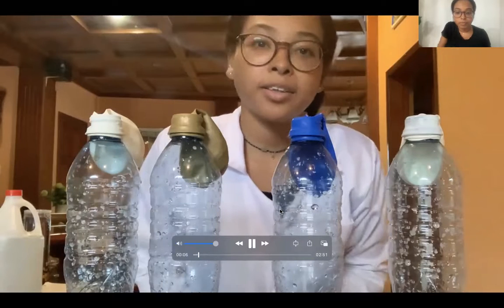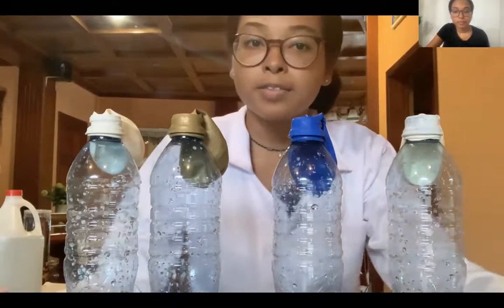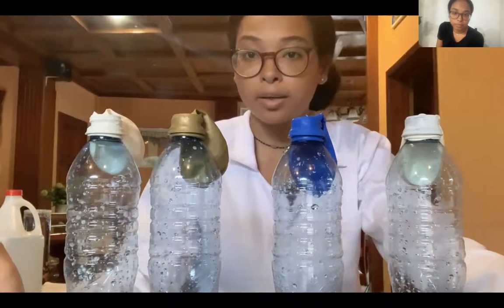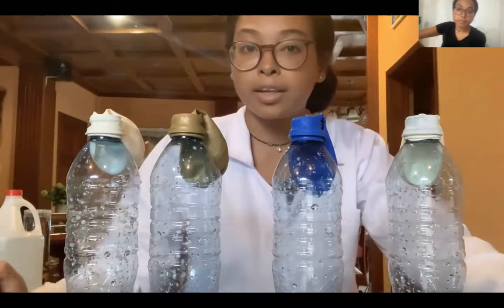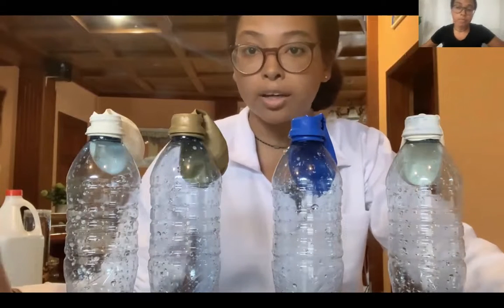My name is Anna. Today I'm conducting an experiment on limiting reactant. The purpose of this experiment is to find the limiting reagent when sodium bicarbonate reacts with acetic acid. The balanced chemical reaction is sodium bicarbonate reacting with acetic acid to produce sodium acetate, water, and carbon dioxide.